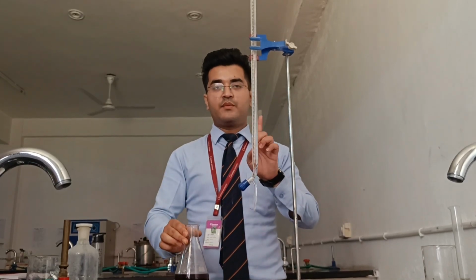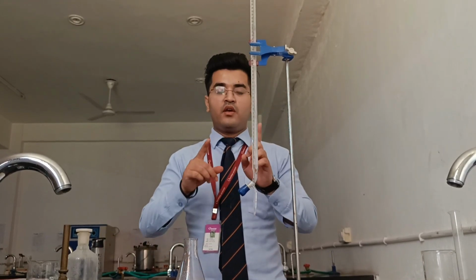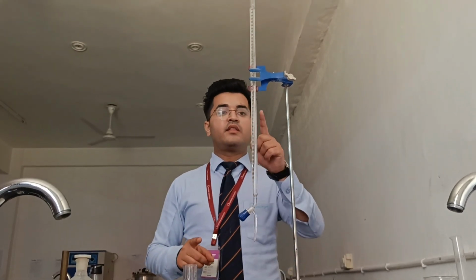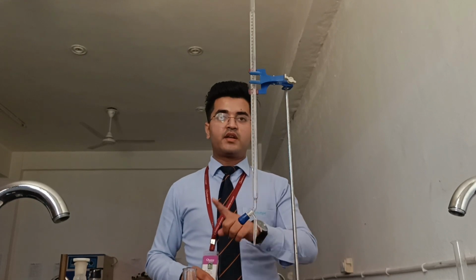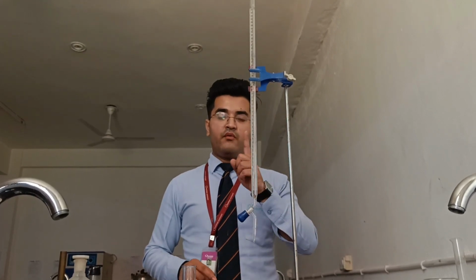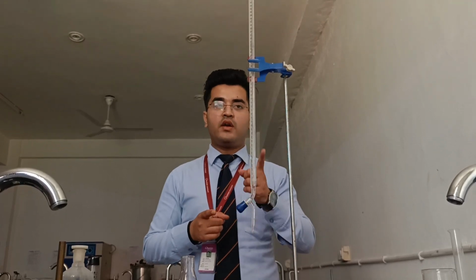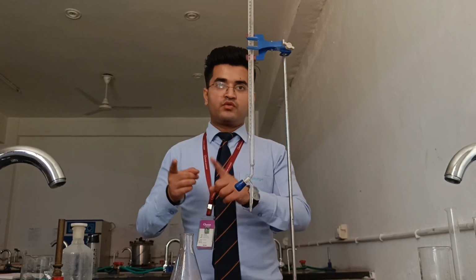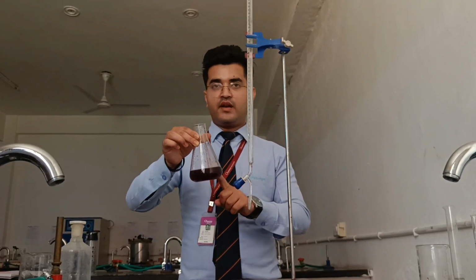So earlier we have seen that the magnesium sulfate and the indicator react to form the color, that is wine red. When we add the EDTA from the burette to the conical flask, the final color will be blue, because EDTA will react with MgSO4 to form a colorless solution, and when Eriochrome Black T is free, it will produce blue. So the end point of this titration will be wine red to blue.